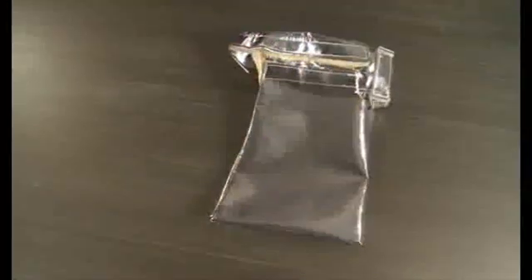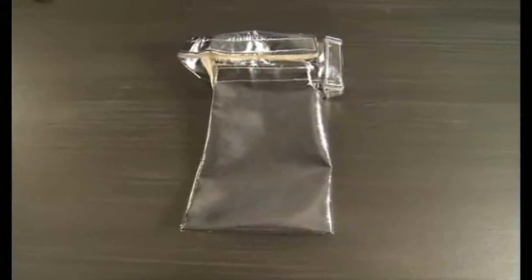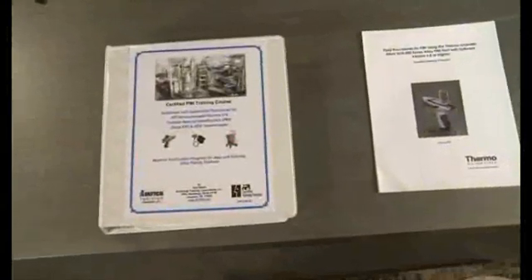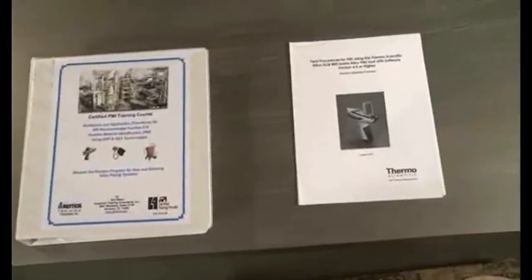PMI Specific Certified Reference Materials, or CRMs. Hotfoot, high temp shielding for use in testing of hot materials up to 850 degrees Fahrenheit. Extend-a-pole, XRF extension pole to reach hot or difficult to access areas. PMI Standard Operating Procedures, Best Practices and Procedures document. API certified PMI training. All specifically designed to provide complete assurance of data integrity under the most rigorous conditions encountered in our industry. We will now go over the PMI kit and its use.